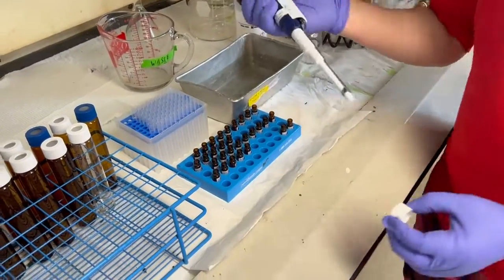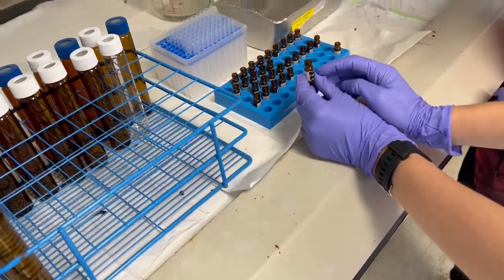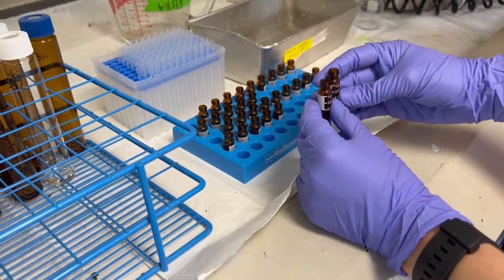You can check on the vials that have little lines on them. So you can see this one's over. And then this one is, I guess, also over.